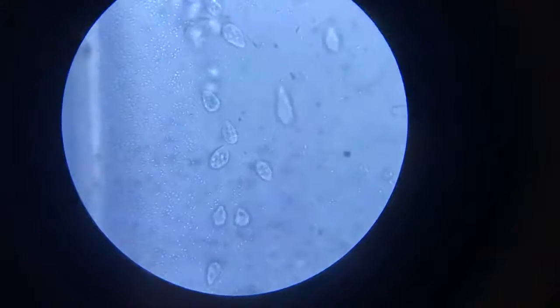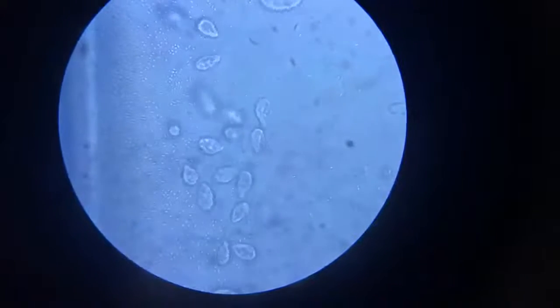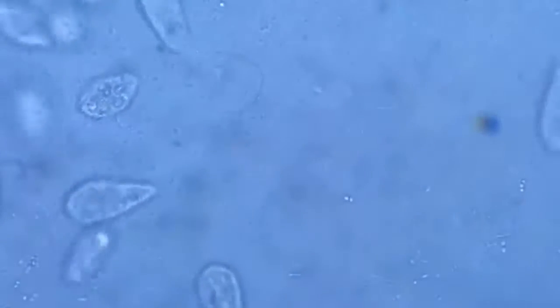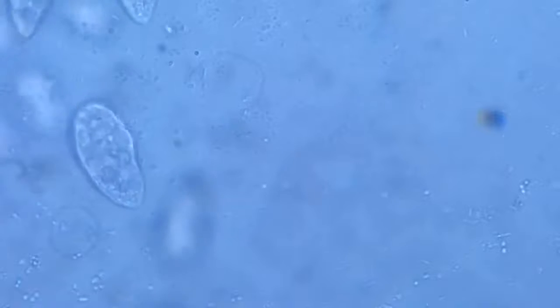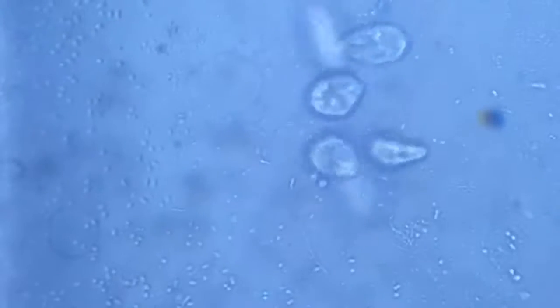A little bit of arrangement is required. All right, so here is a gathering of some ciliates, a few of those individuals are in the process of reproduction, and we'll see a few. Just watch them.